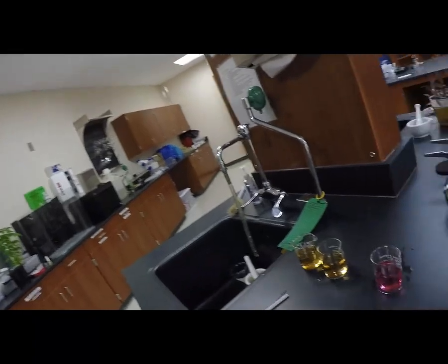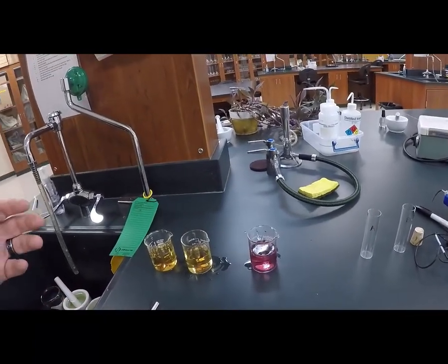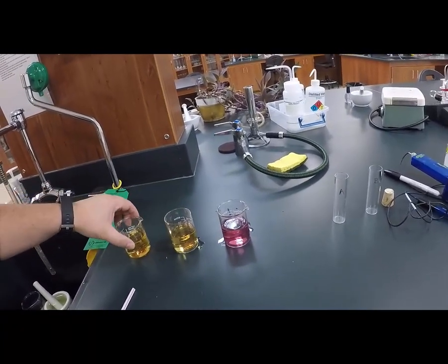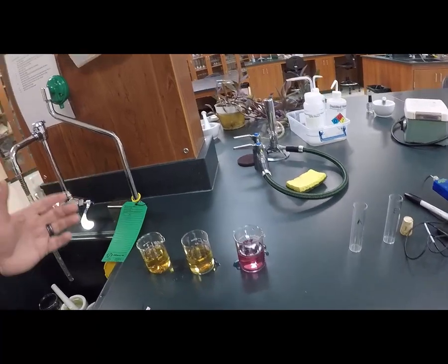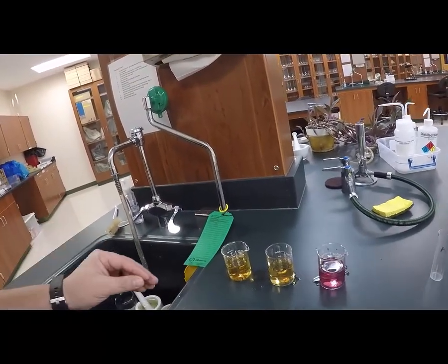Okay, so now we are going to demo the uptake of carbon dioxide by photosynthetic plants. I'm using an indicator dye here, which is called phenol red, and it's a combination of phenolphthalein and some other solutions, but regardless, it's an indicator of an acid. So phenol red is an indicator of an acid.